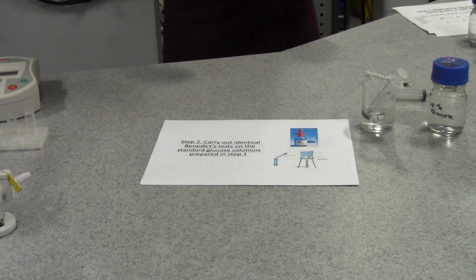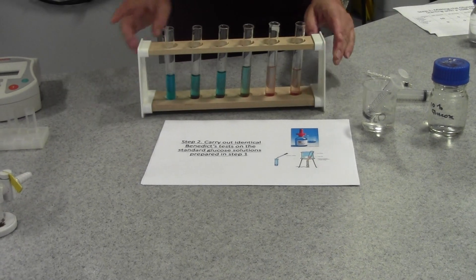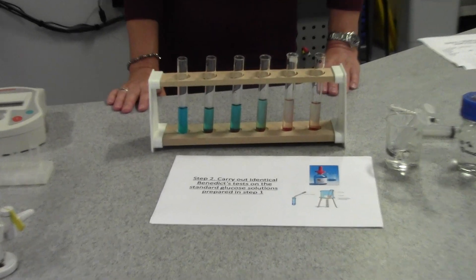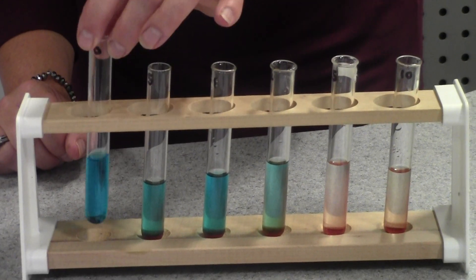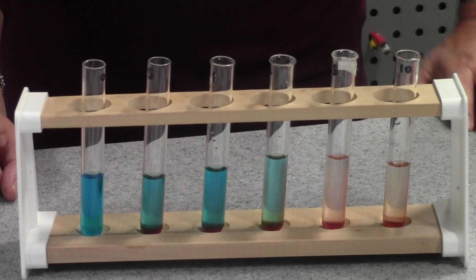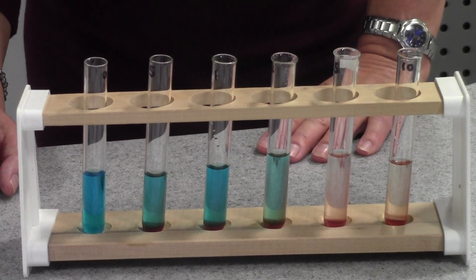As soon as we've removed the solutions from the water bath, we should find that we actually get a range of different results. For example, here is the 0% glucose solution and you can see that all of the blue Benedict's remains—there's no reaction taking place there.